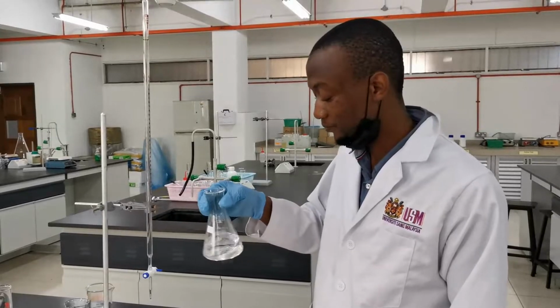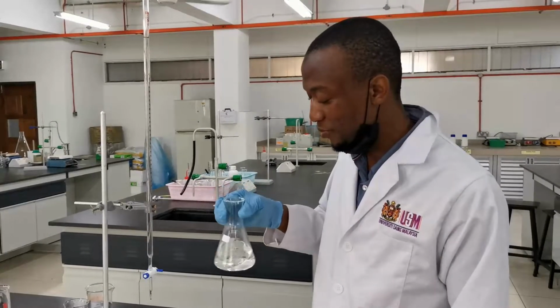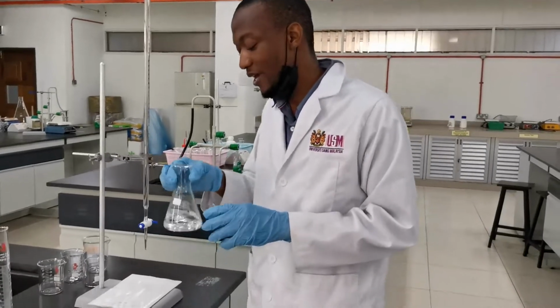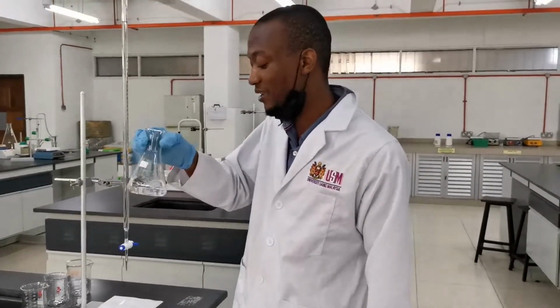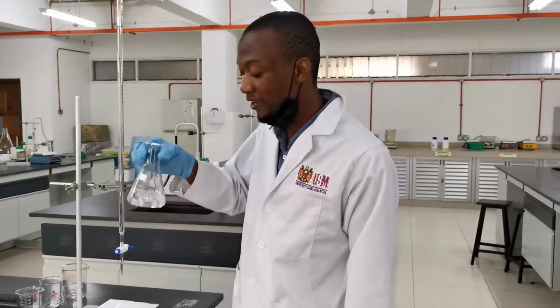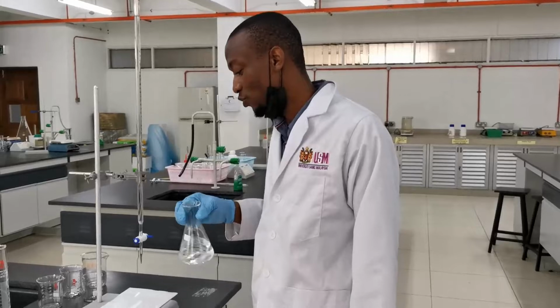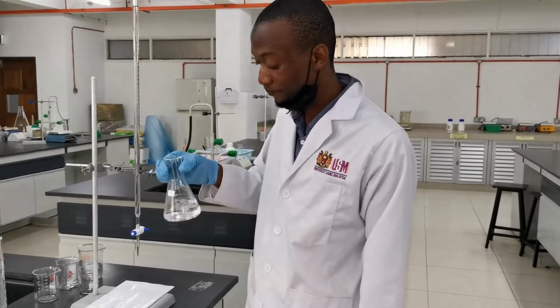Remember that KHP is an acid and is a primary standard. That is why it is being used to standardize sodium hydroxide.